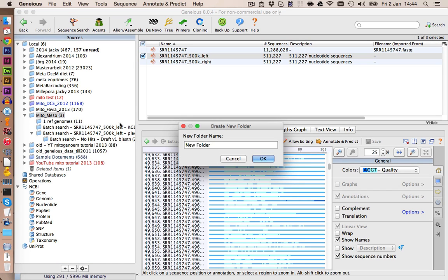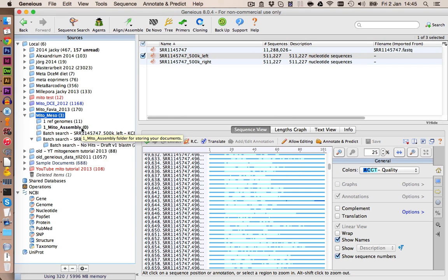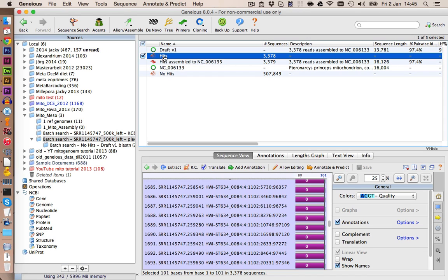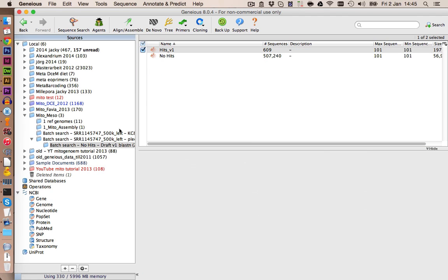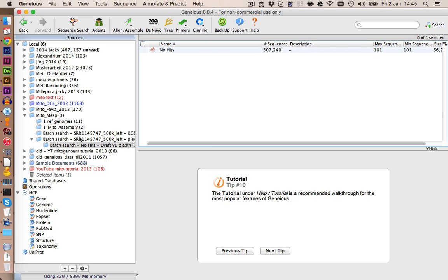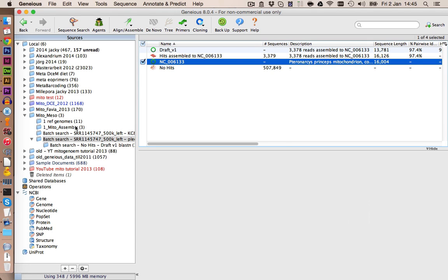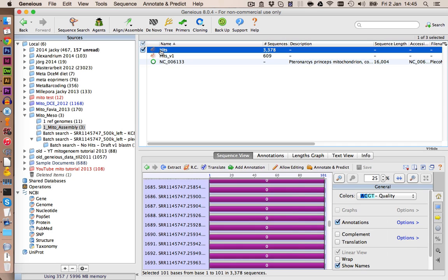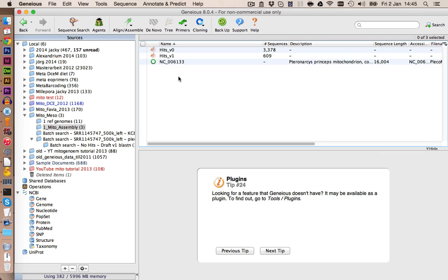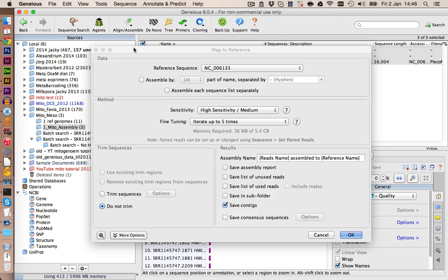Also we can make a new folder in here. And let's just store all our relevant data in this folder so it doesn't get too messy. We copy our hits. We copy our hits v1. And we are also going to copy the reference genome into this folder. Let's maybe call this one version 0. Alright. Let's now select all 3 of them. And we again use map to reference.